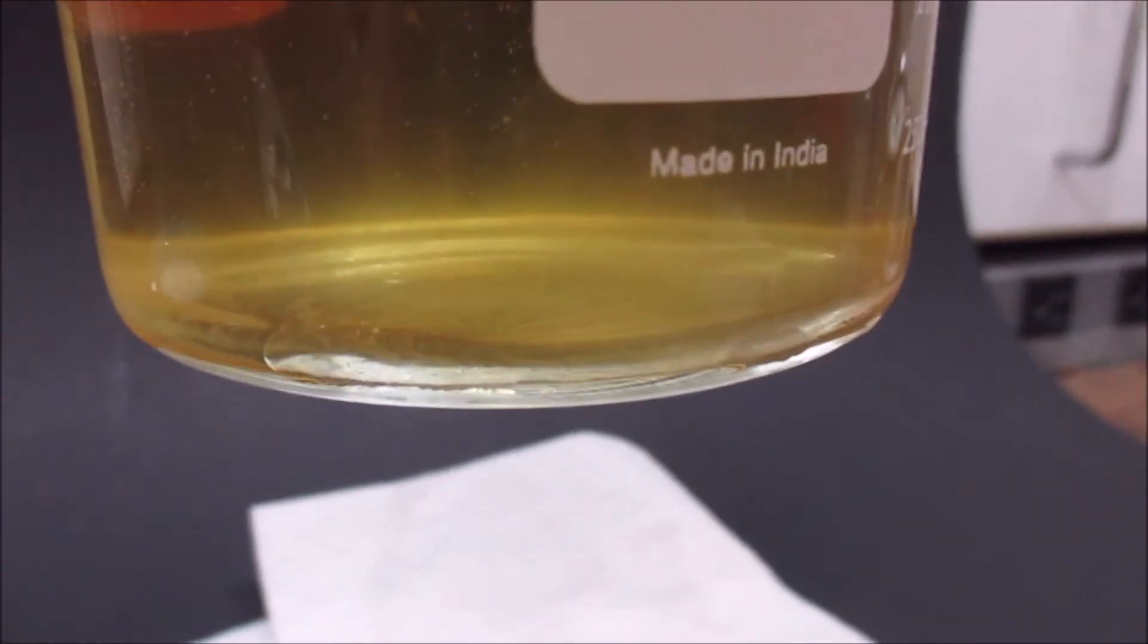After a while, the chloroform settled out in the bottom of the beaker as a nice looking blob, which I think looks pretty cool.